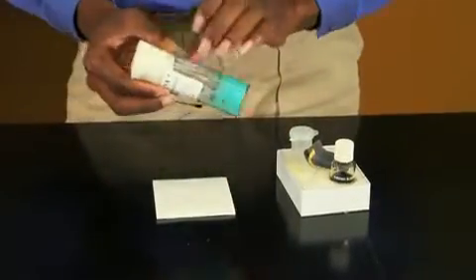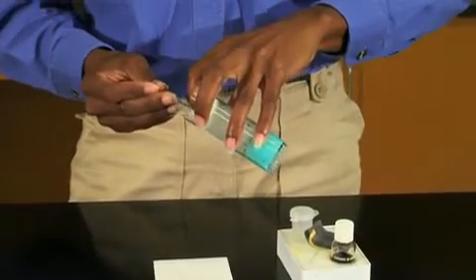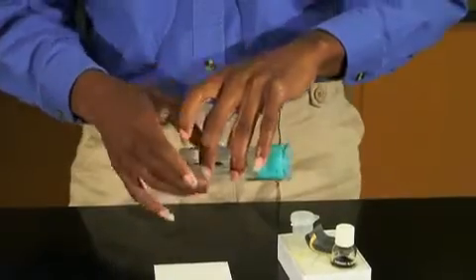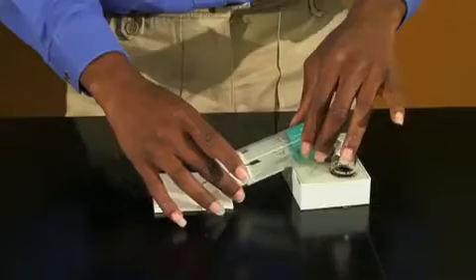If it is not possible to transfer flies into an empty vial, lay the culture vial containing medium on its side while anesthetizing flies, or position the vial at a 45 degree angle with the mouth facing down.